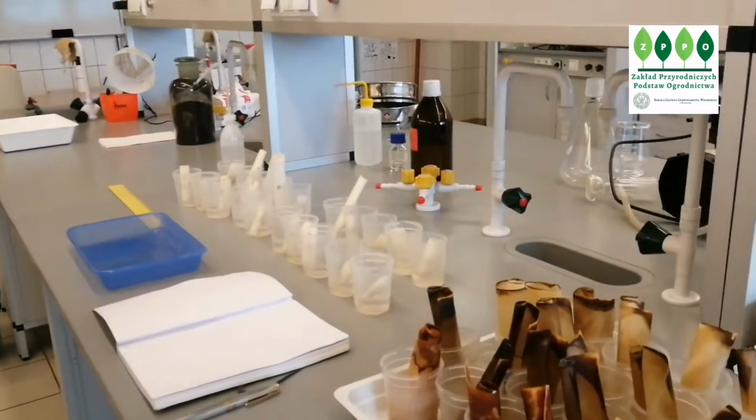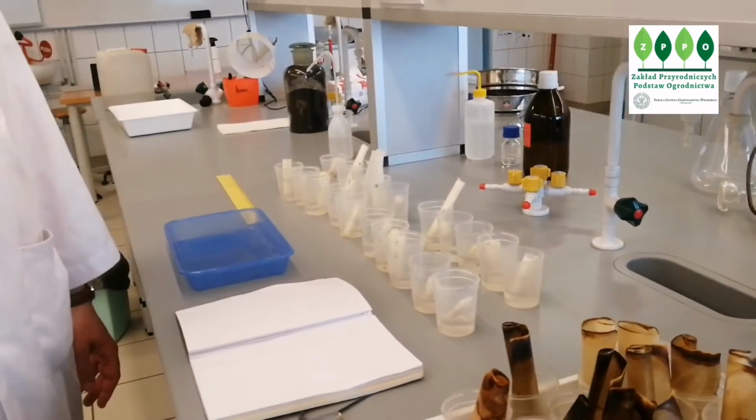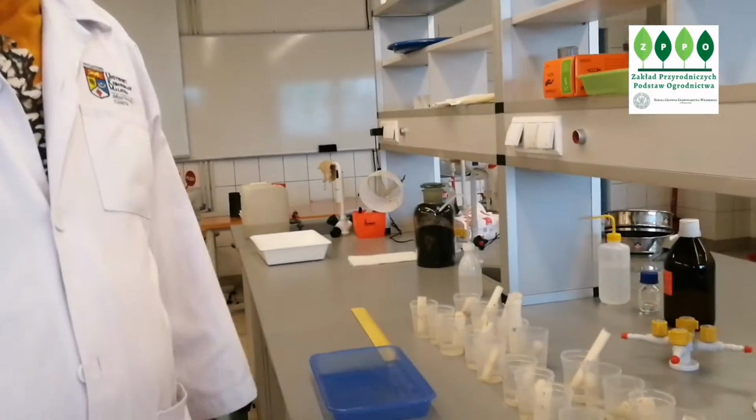This is our experiment. As you can see, plants were grown, the seeds were germinating under darkness for 5 days maybe. When we saw first seedlings, we took them out from the growing chamber and we just placed them on the table. Room temperature, little access to light, just the light from the window. Today they have a week.